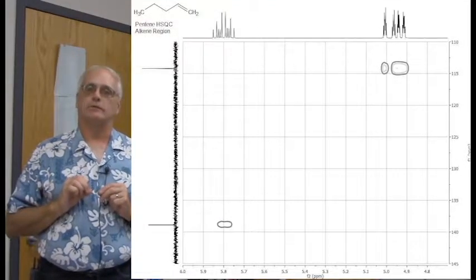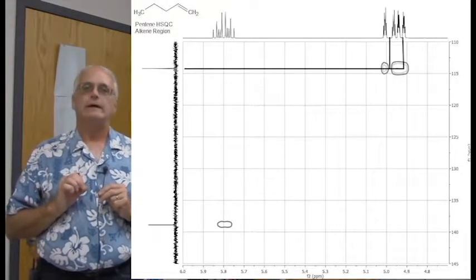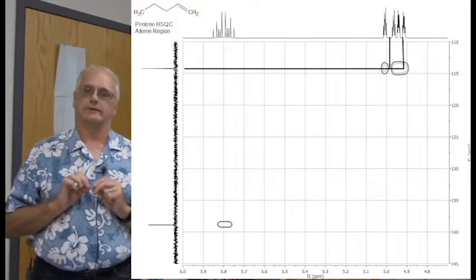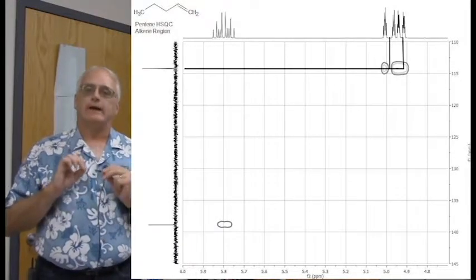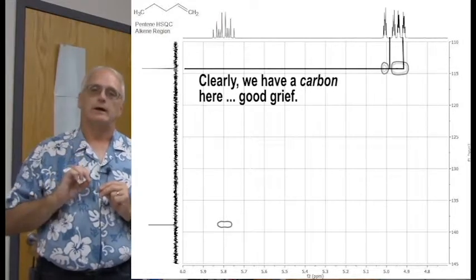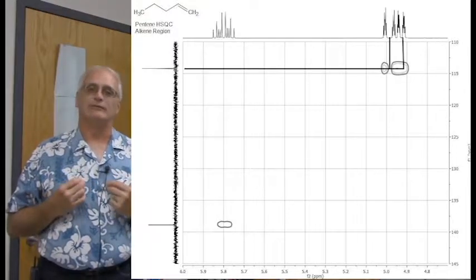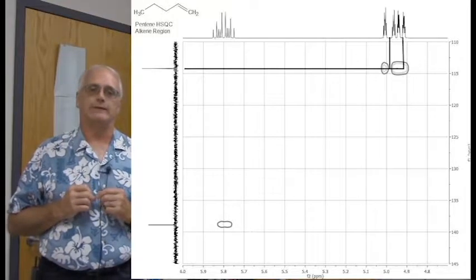And sure enough, you can see the correlations, the CH2 group of the terminal alkene correlating to these two signals. Now you notice this time around it's a little bit different. You don't see the exact doublet nature anymore because they are closer together, and the HSQC is a lower resolution spectrum. But clearly we have a CH2 group correlating to two separate protons. Once again, the two protons are not equivalent to each other, which is a common sort of thing in many different types of methylene groups. It's one of the things that makes the methylene group a complicated one. Here it is in the terminal alkene case.